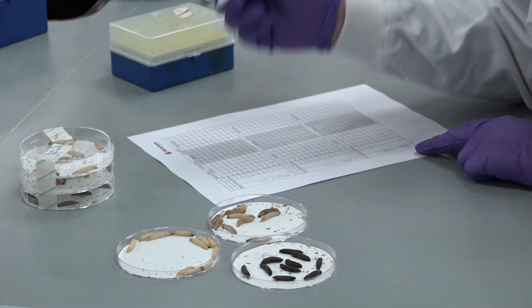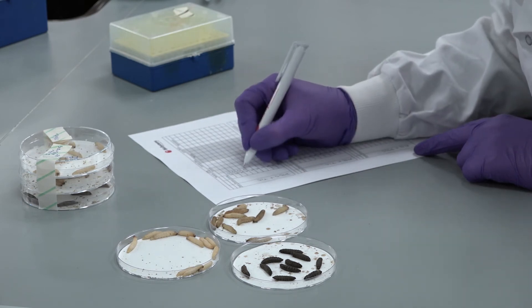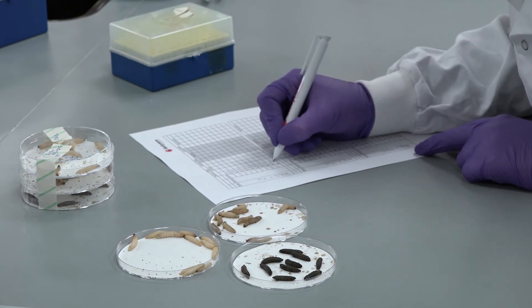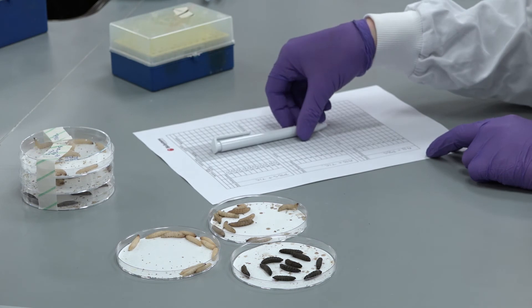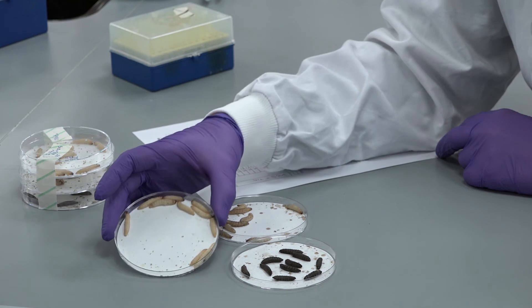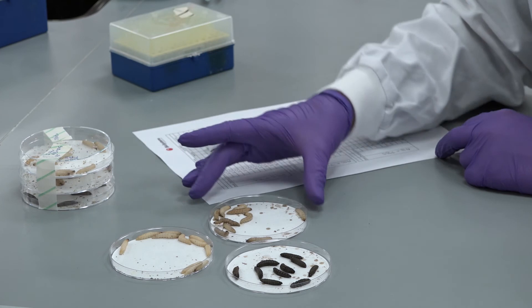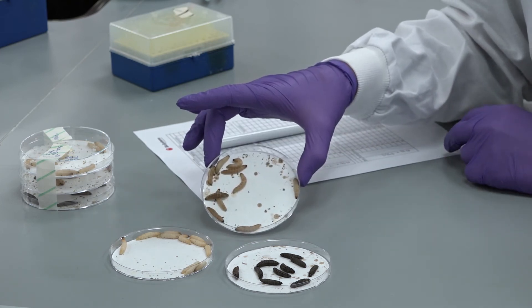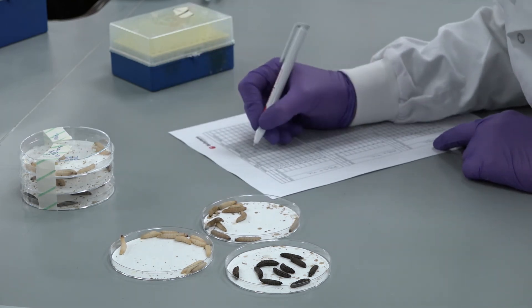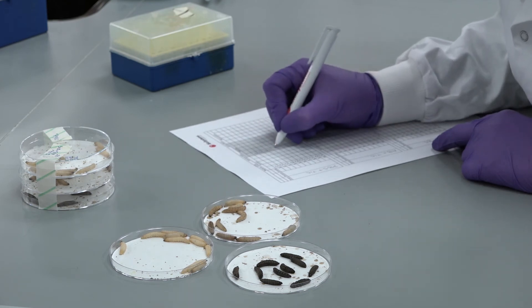Score survival of the larvae. Antimicrobials demonstrating activity to the pathogen will result in increased survival of the larvae or a longer time to death compared to the pathogen only control. Here we can see injection only controls, pathogen only controls, and pathogen plus antimicrobial. We can clearly see that tigecycline can rescue larvae from Acinetobacter baumannii infection. This experiment can be repeated three or more times to provide greater statistical power.